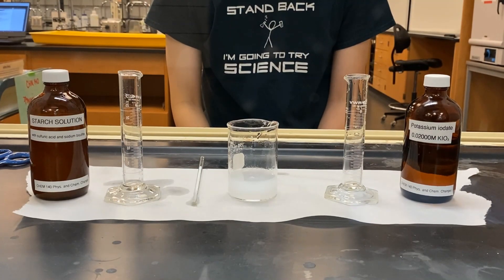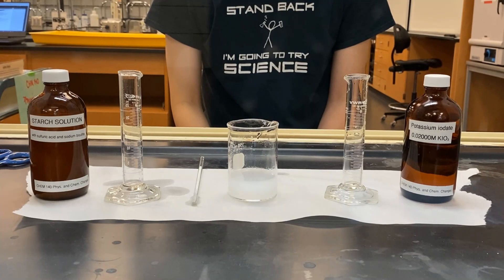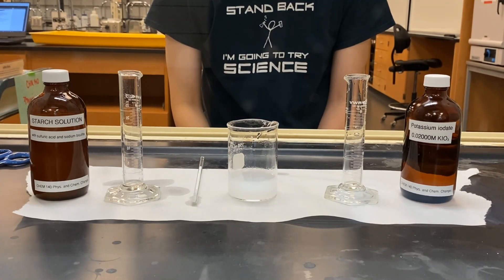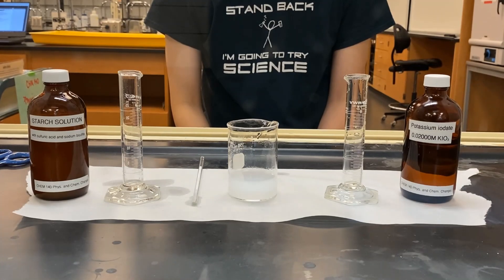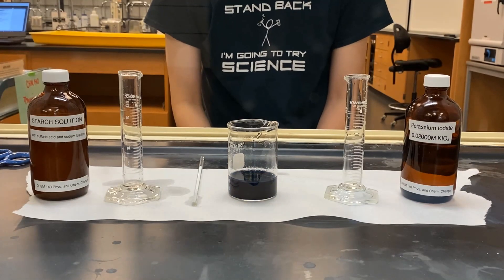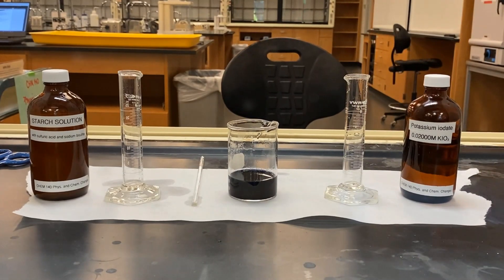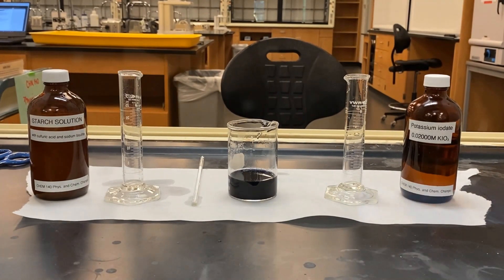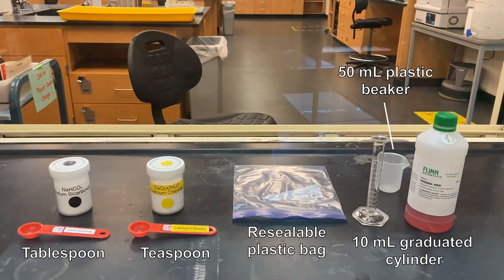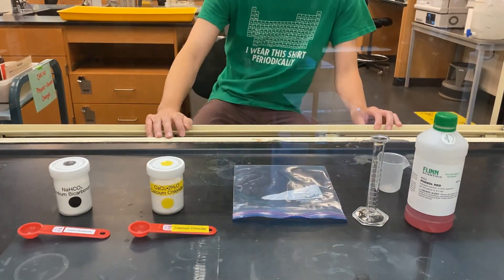Keep your eye on the mixture. We'll be looking at a reaction between three different substances: sodium bicarbonate, calcium chloride, and phenol red.